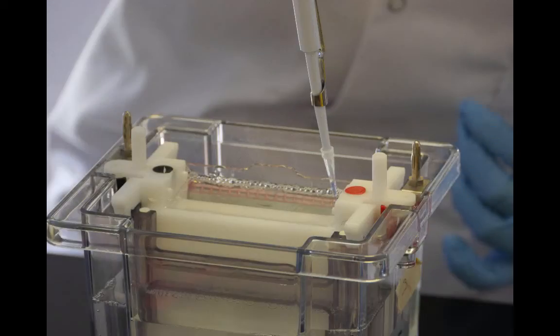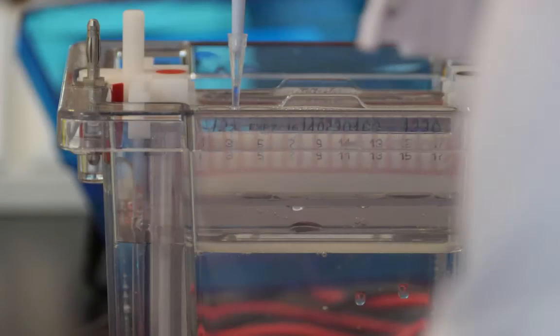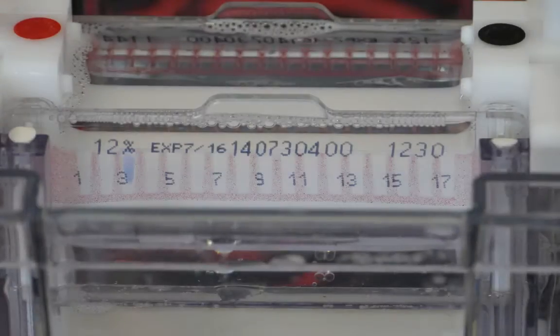Proteins were then loaded into the wells of the gel using a white tip pipette and the sample sat in the bottom of the well.